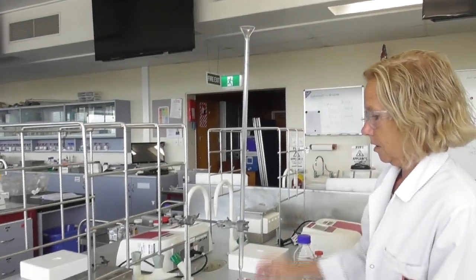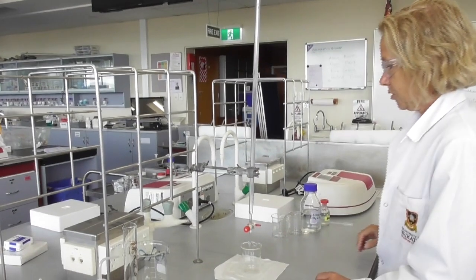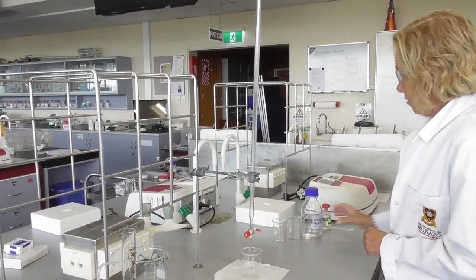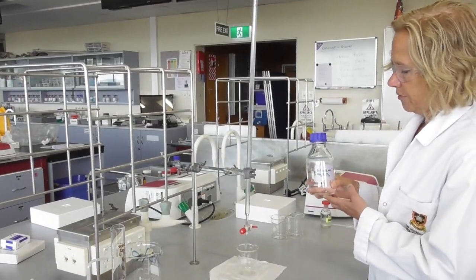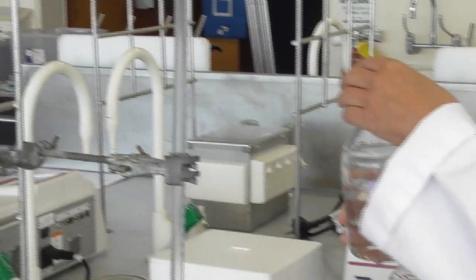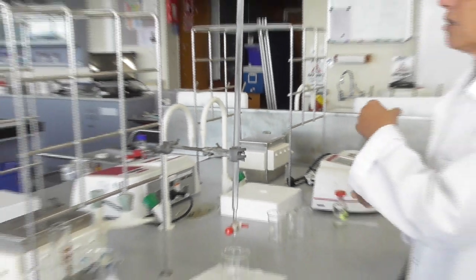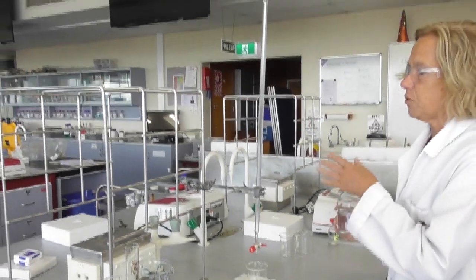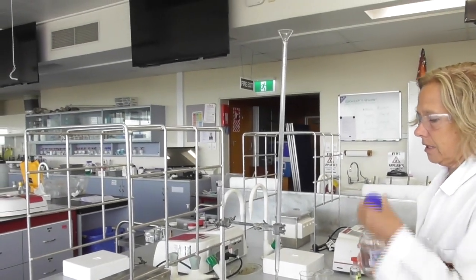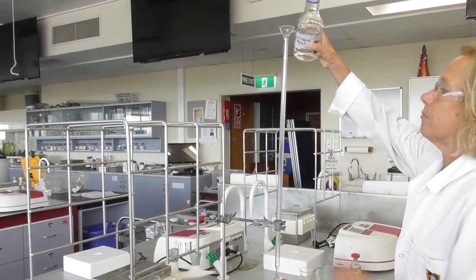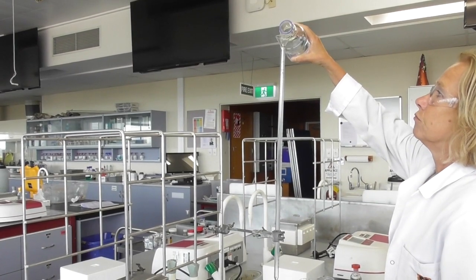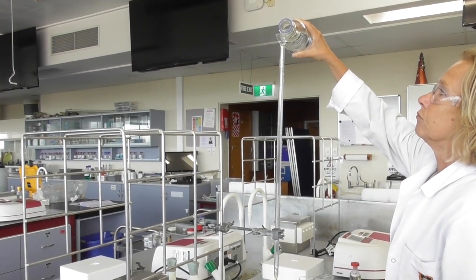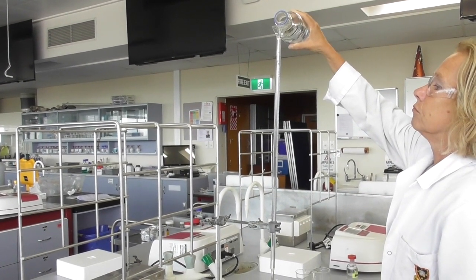In the meantime I can fill my burette with thiosulfate solution. I put a waste beaker underneath, funnel on top, and make note of the concentration of the thiosulfate solution which is 0.1036 mol per liter. As the burette is clean I don't need to rinse it and just can fill it up straight away.